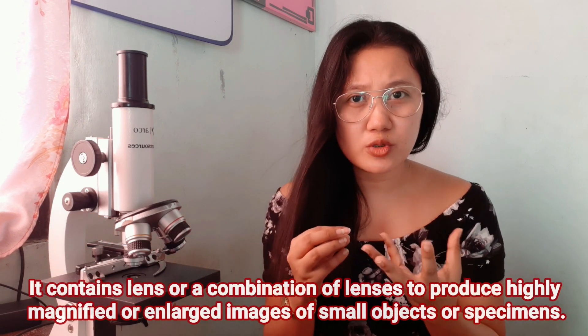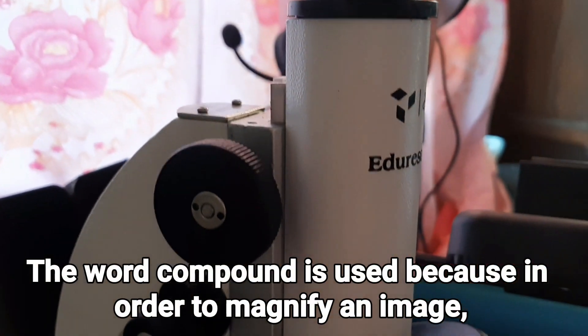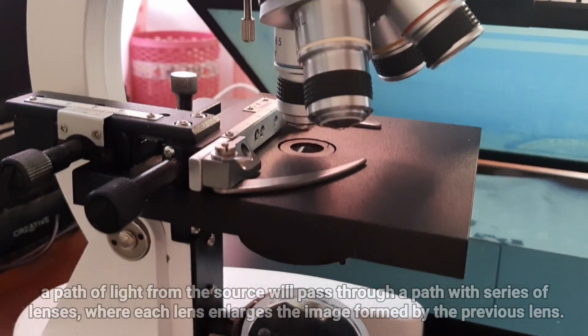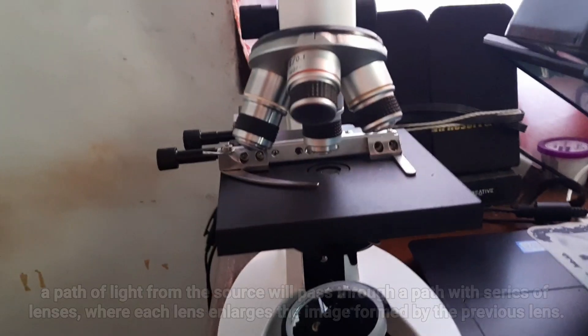A microscope is an important tool in studying living organisms. It has different lenses and combinations of lenses to produce highly magnified and enlarged images of small objects or specimens. The compound microscope is the most common type. The word 'compound' is used because a path of light from the source passes through a series of lenses where each lens enlarges the image formed by the previous lens.